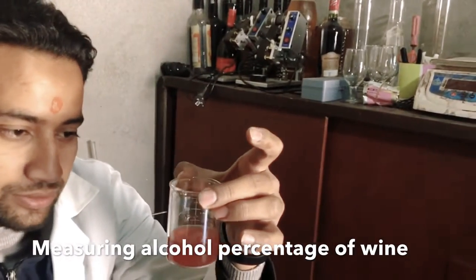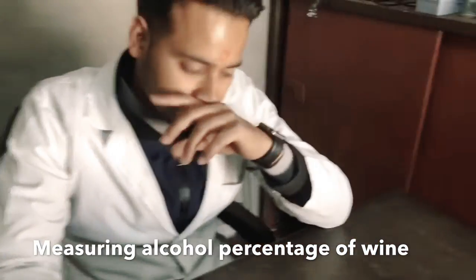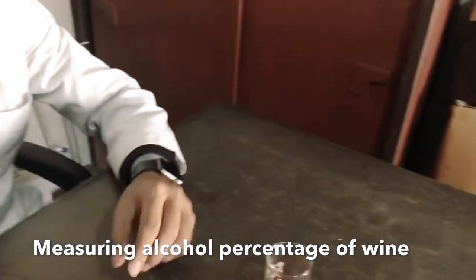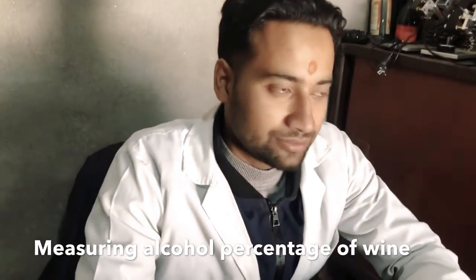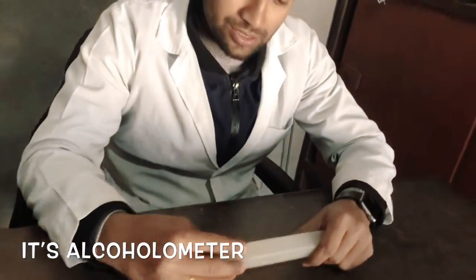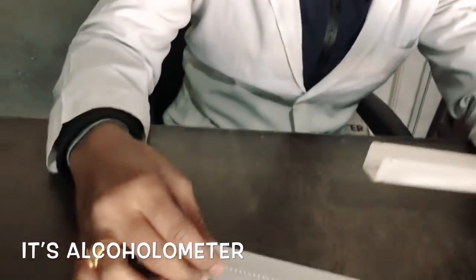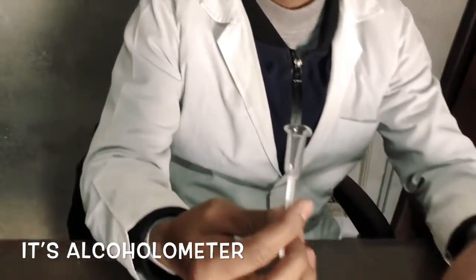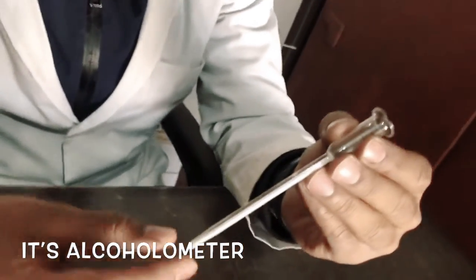Here we have one sample — a red wine sample. It is a black-red grape wine. Here we have the instrument. This is known as an alcoholometer. It is used to measure the percentage of alcohol. Here we have a reading.